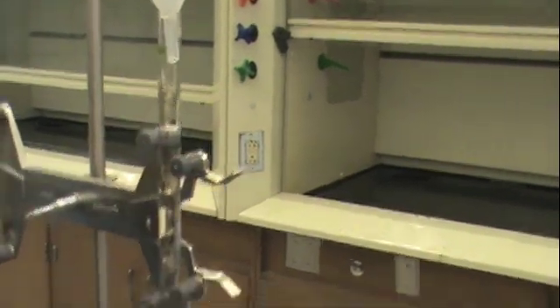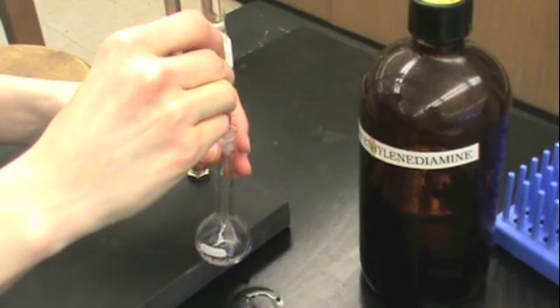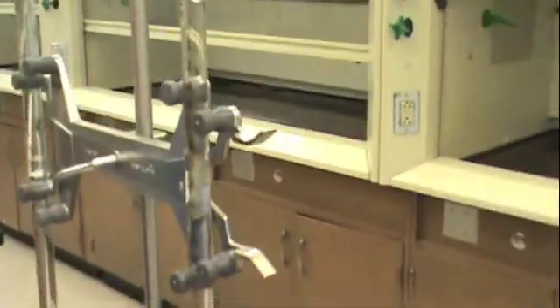Then if you have a second reagent you need to add to your solution, go ahead and add it also from a burette to get accurate concentrations of each reagent.